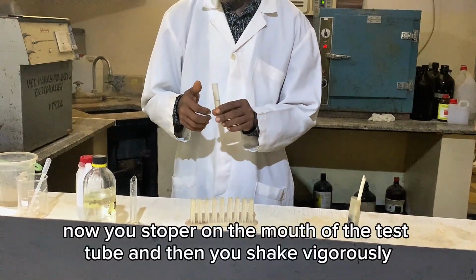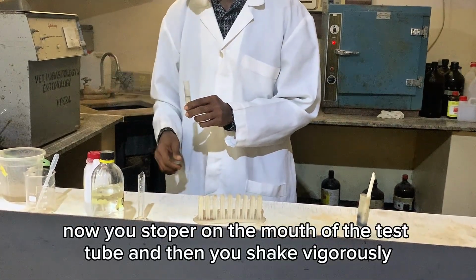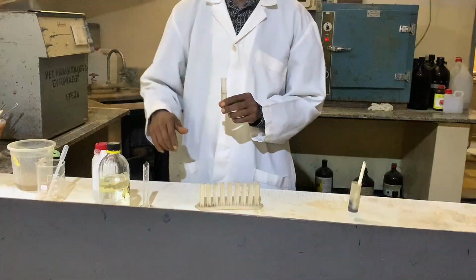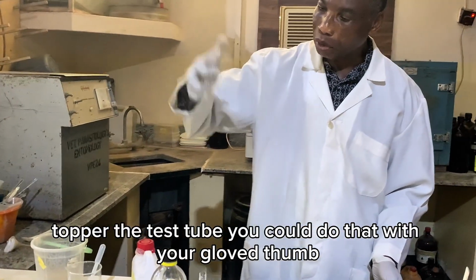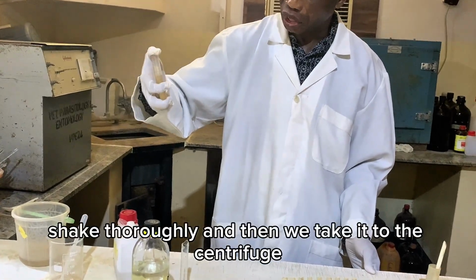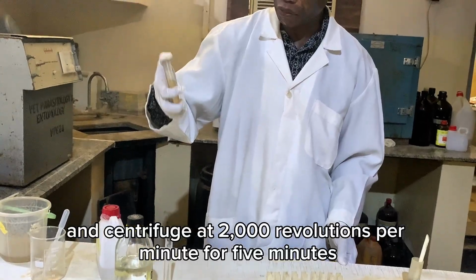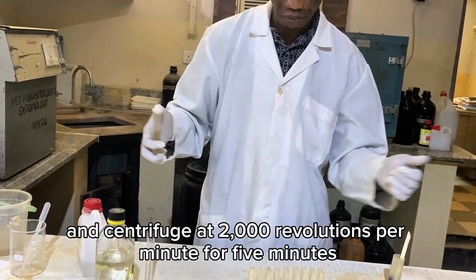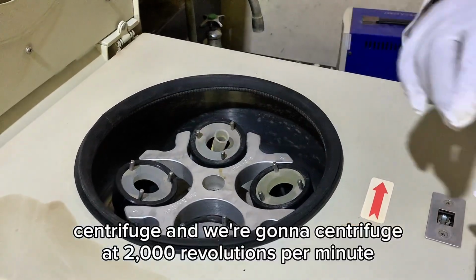Now you stopper the mouth of the test tube and then you shake vigorously. Stopper the test tube. You can do that with your gloved thumb. Shake very well. Shake thoroughly. And then we take it to the centrifuge and centrifuge at 2000 revolutions per minute for 5 minutes.